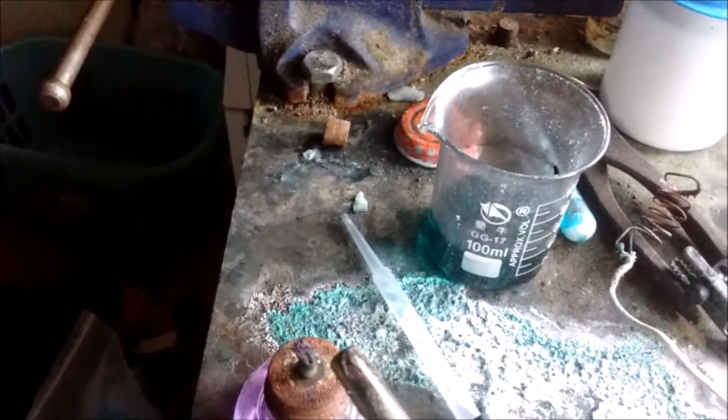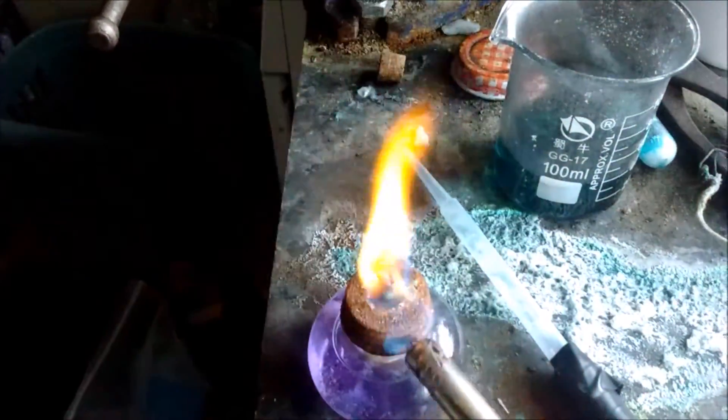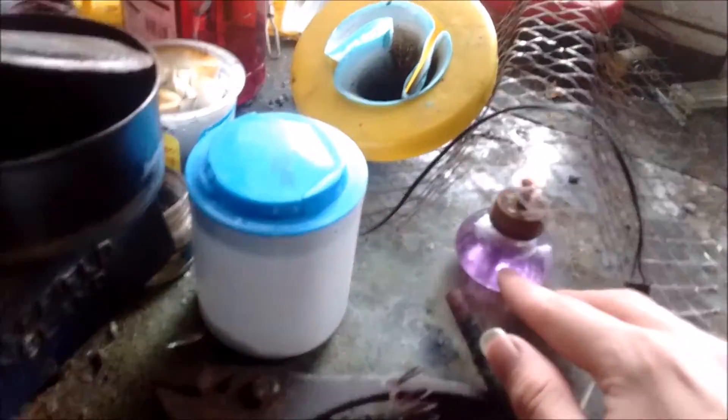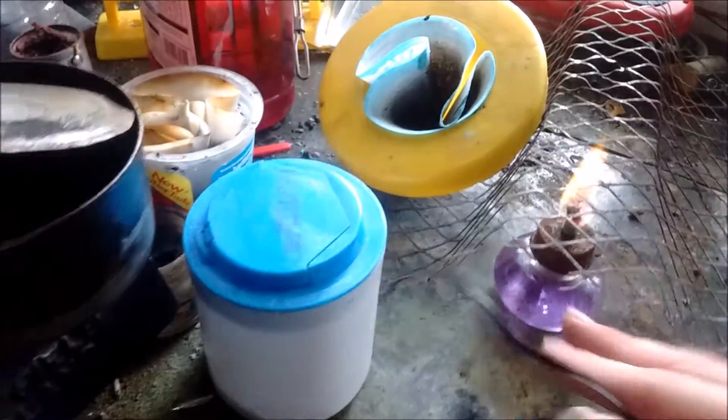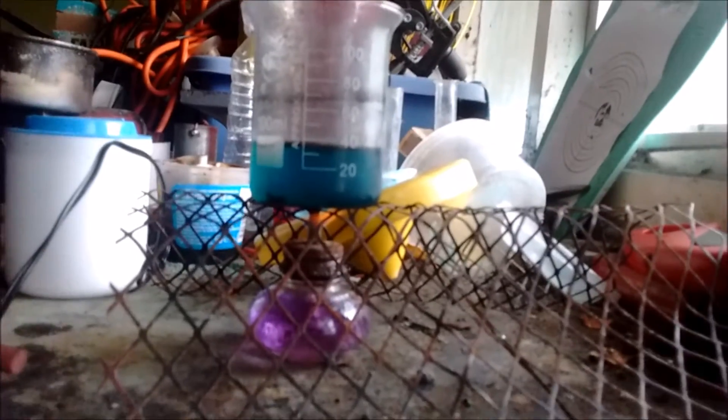What I want to do now is boil it down until the copper sulfate starts to drop out of solution — that means you're starting to get rid of most of the water. My lighter didn't work, but as soon as you say that something doesn't work, it immediately starts working for fear of your wrath. Do not set fire to wires — they tend not to like it. So yeah, that's gonna sit there for the next few hours.